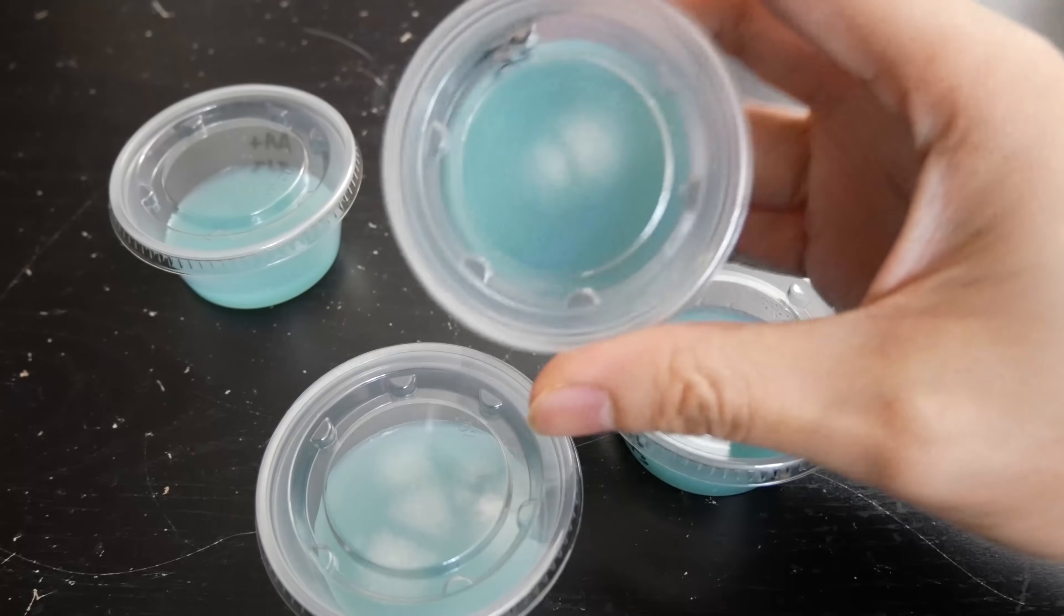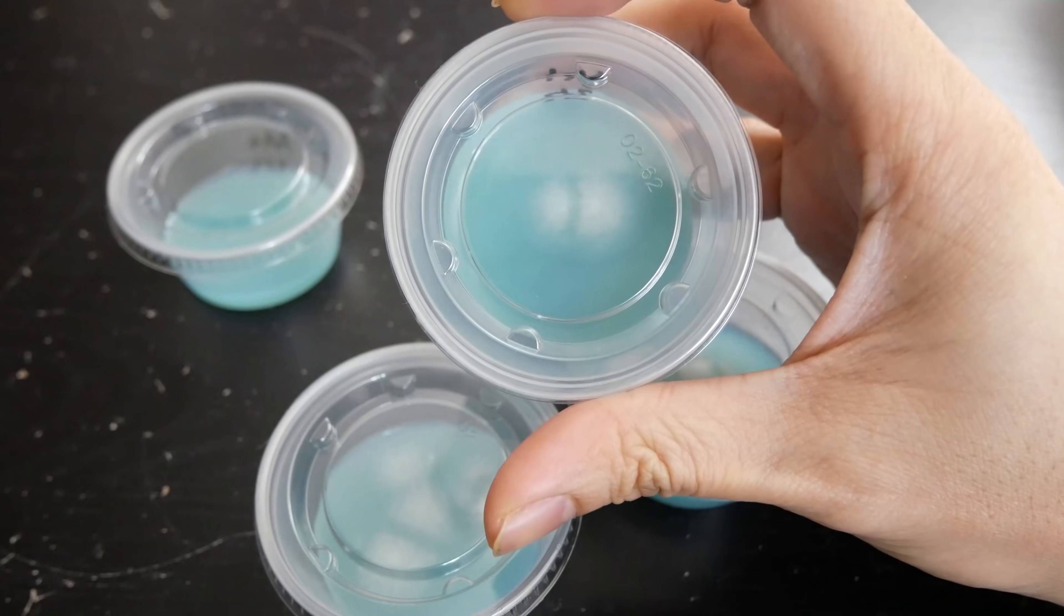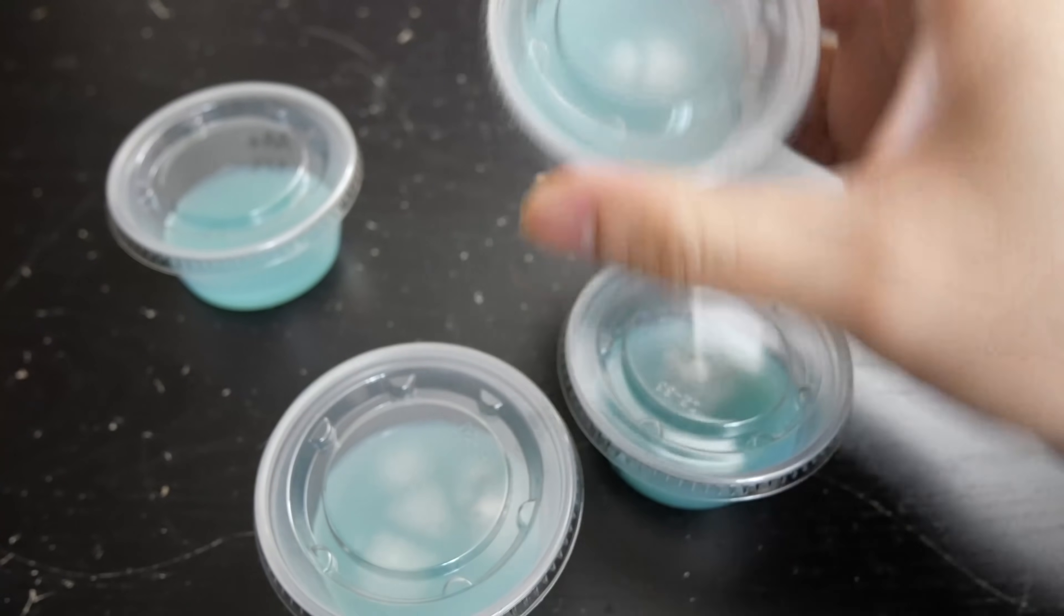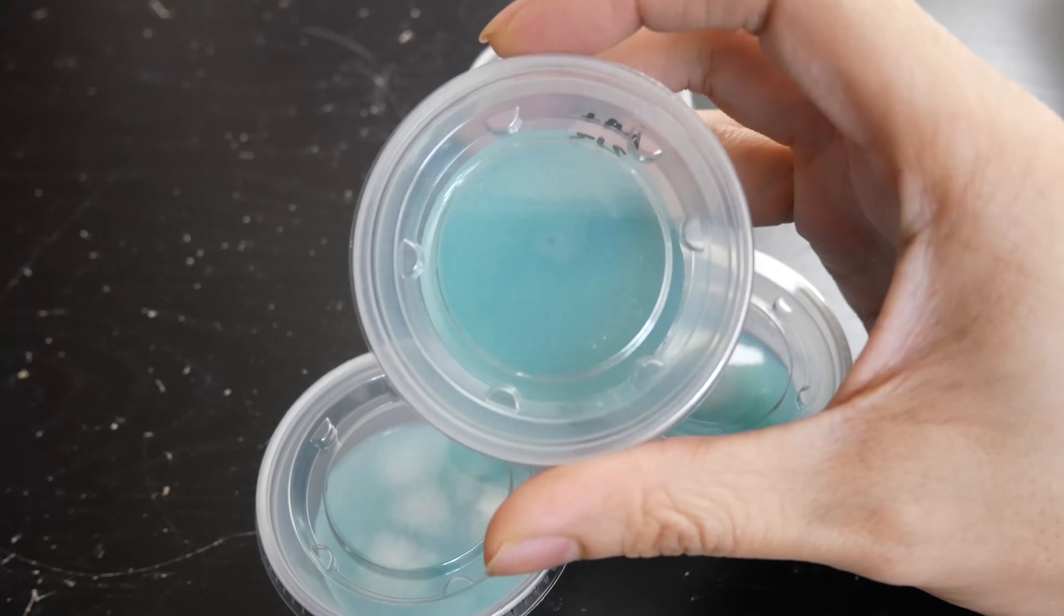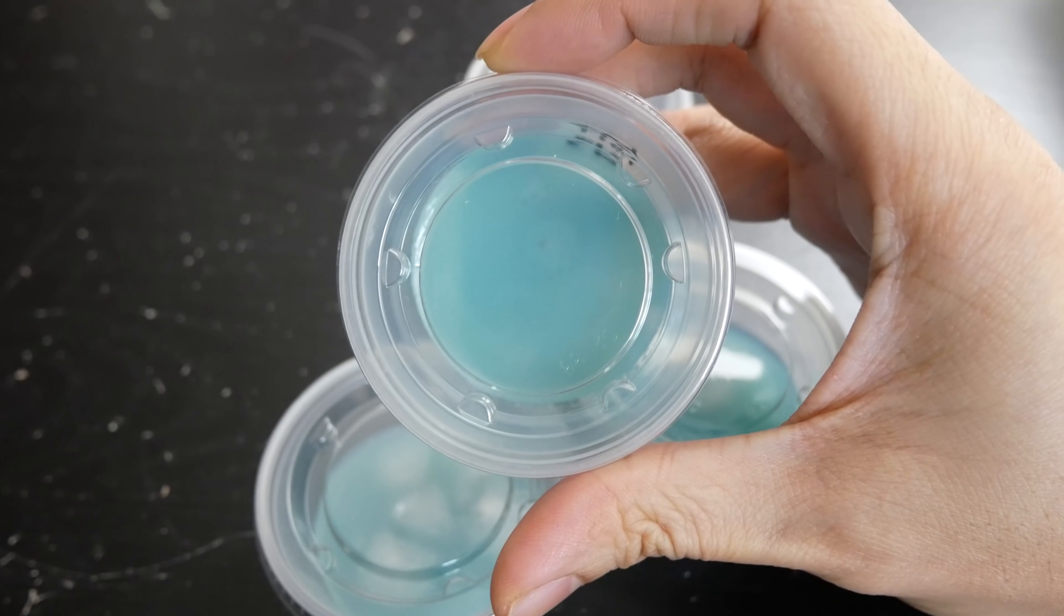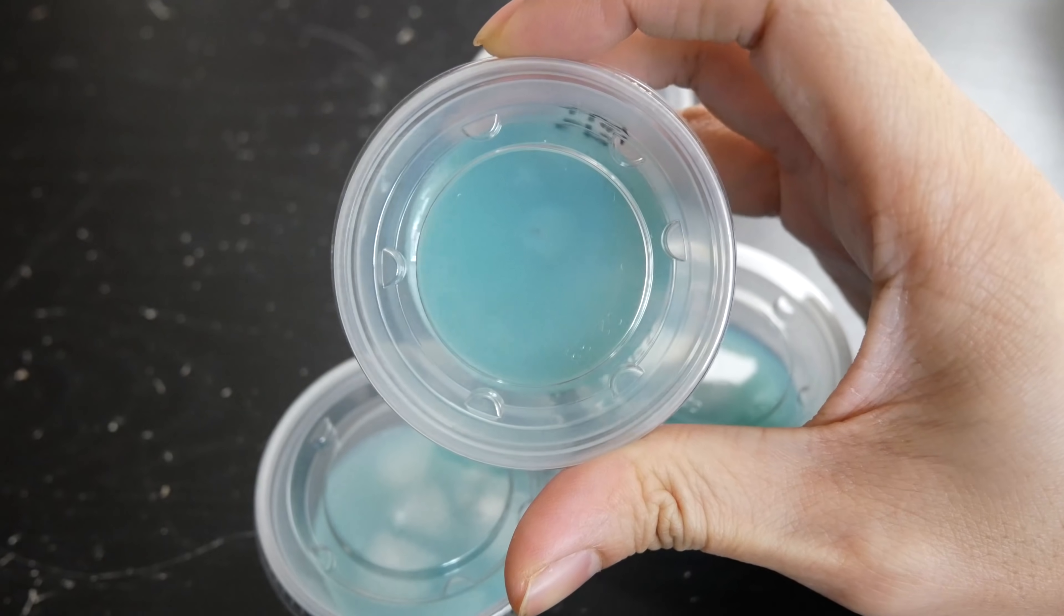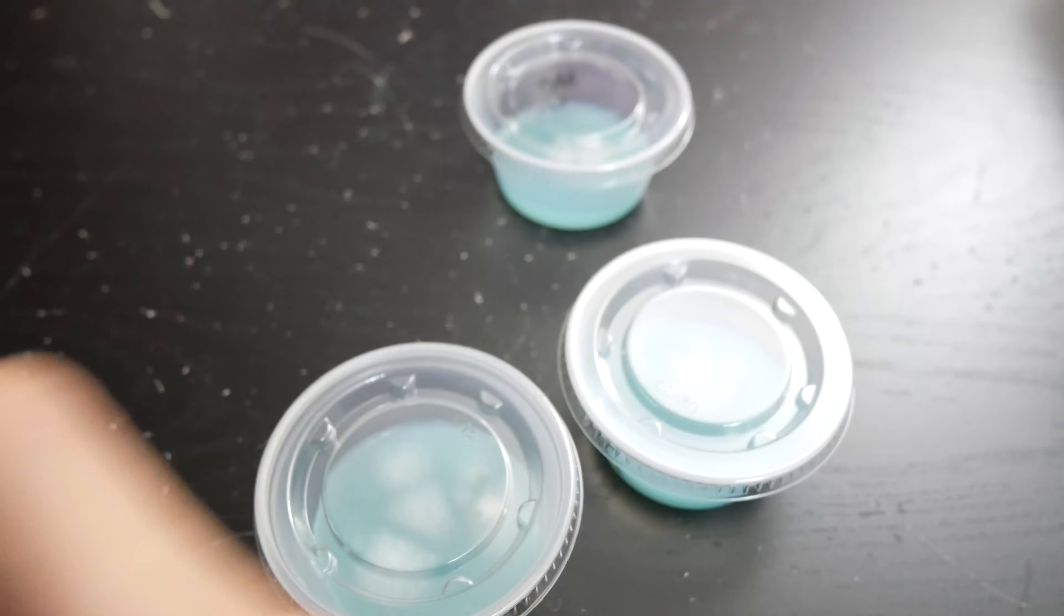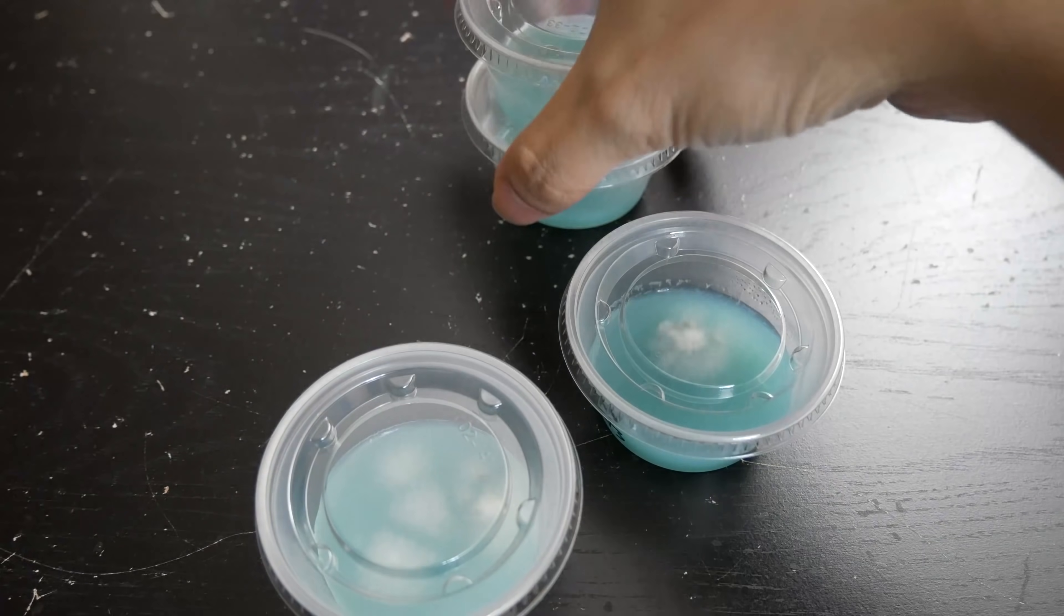Now at this point it's still a bit early. I like to leave these out to germinate a bit longer before I start making transfers out of these. Typically I'll wait about two weeks in order to decide what to do with them. Here's one of the cups that hasn't quite germinated fully yet. You can see a little bit of spores there that's starting to germinate but hasn't quite developed any strong mycelium in there just yet. But you leave this out for another week and I'm pretty sure you'll start seeing mycelium fuzz all over in there.